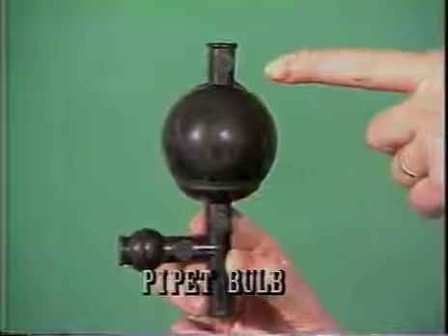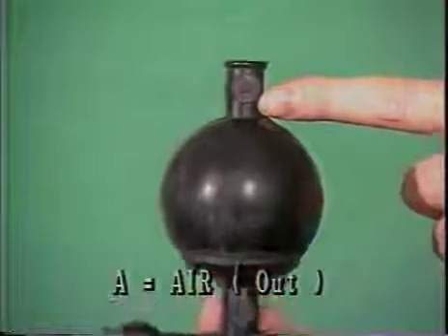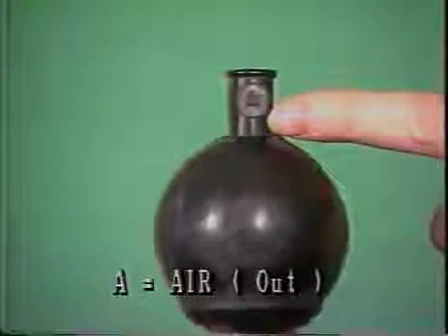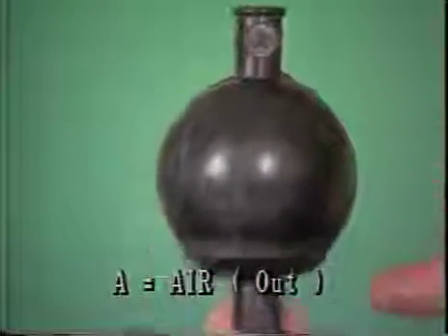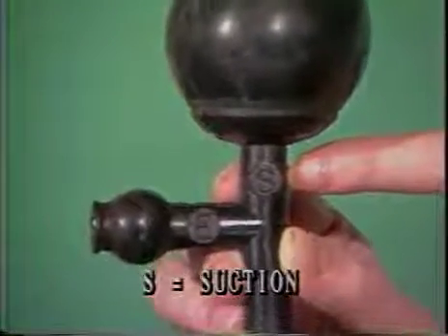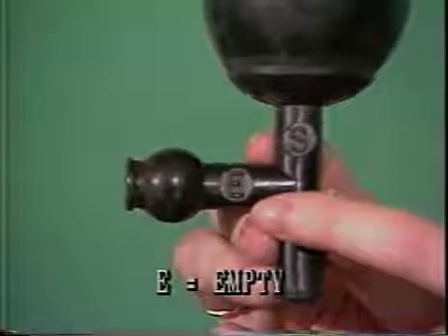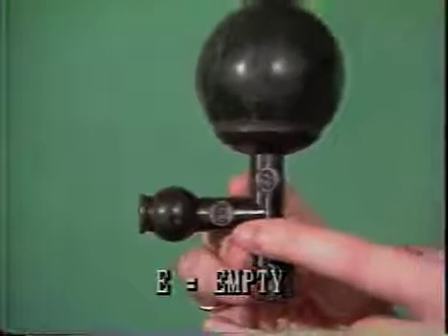There are several valves in this bulb. This one up here is letter A, for air, letting air out of the bulb. This one down here is S, for suction, for sucking liquid up. And this one here is E, and that is in order to push this in order to empty the pipette.